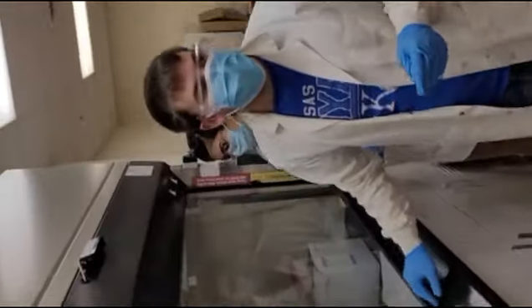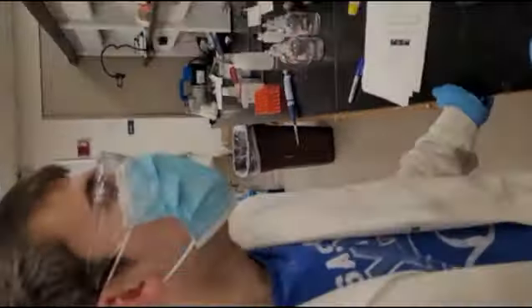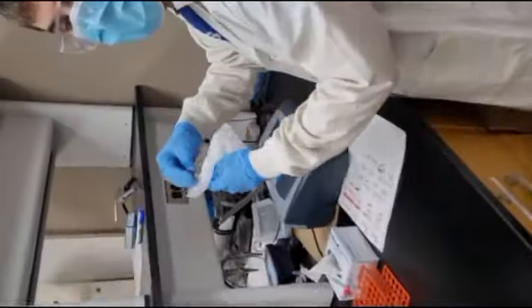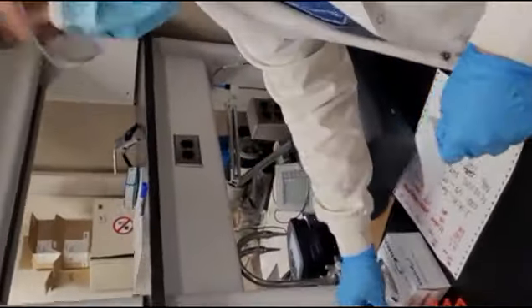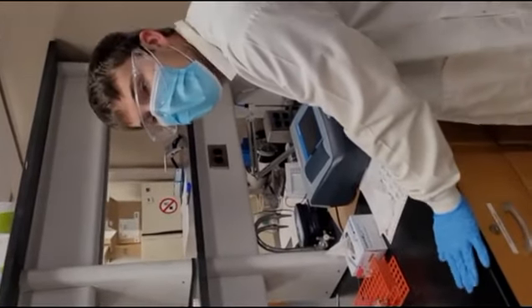And for measuring them, it's just like all the other HACH kits you've done. You put this in the spectrometer, wipe it so that we have a clean vial for the light to pass through, and you'll put it in the instrument. And that's it for this week's lab.